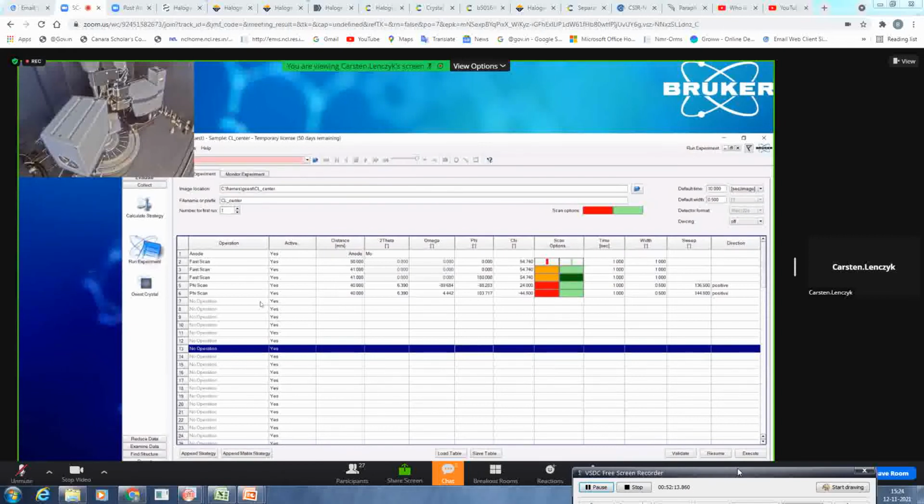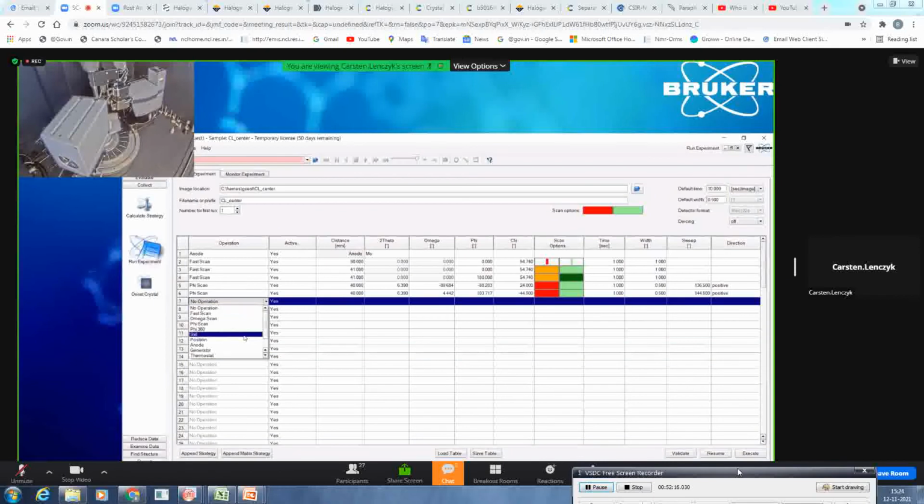What else can we do here? You can basically control everything necessary for you. So for example, you can collect a crystal video afterwards. I would always suggest to do so, especially if you have a cryo attached, because for the crystal video, it will drive into a position perpendicular to the cryo and will do a 360-degree scan. And sometimes it happens that it will have icing afterwards. So please always do the crystal video afterwards.